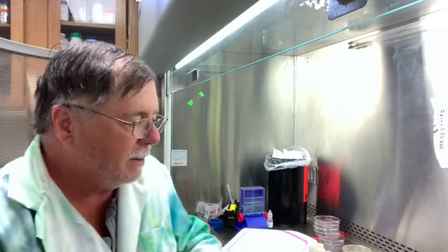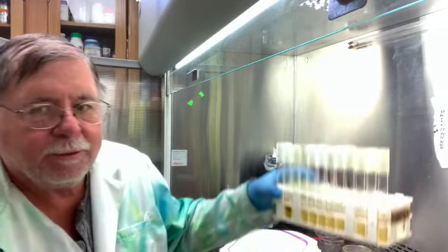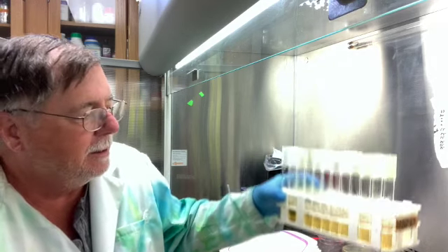What I'm going to do today is just inoculate these tubes, and this is what they look like. And then when we do the Voges-Proskauer test, we'll take 1 milliliter of the grown culture, put it in another tube, and add some chemical reagents, A and B, and look for a color change.